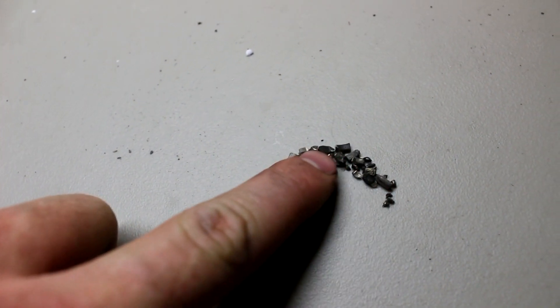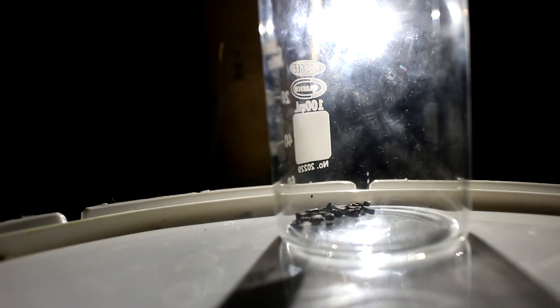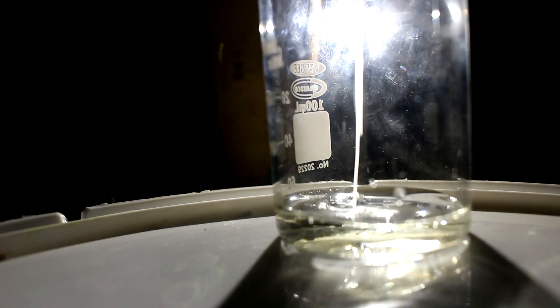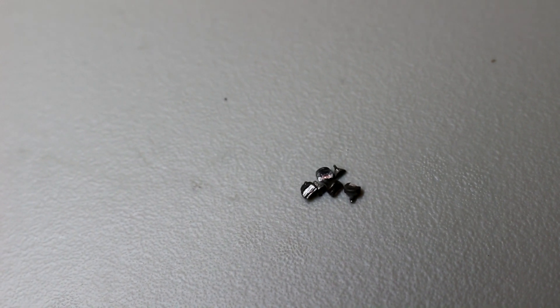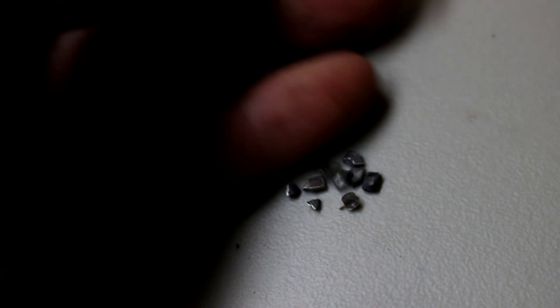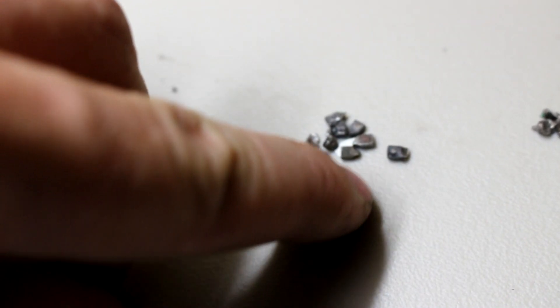Here's all the little platinum points from 20 or so spark plugs. Now I'm just going to put these in acid to dissolve away the base metals. Some nitric acid should make short work of those pieces of metal, but it won't touch the platinum. While that's dissolving, I'll process the other spark plugs to extract the iridium and palladium. There are the contacts from the iridium spark plugs — I managed to save six of them. Here are the ones from the unknown spark plugs. These may contain palladium, so I can't use nitric acid on these; I'll have to use hydrochloric acid, which dissolves them more slowly but will keep the palladium from being dissolved. Iridium has no acids that dissolve it, so I can use nitric on that just fine.